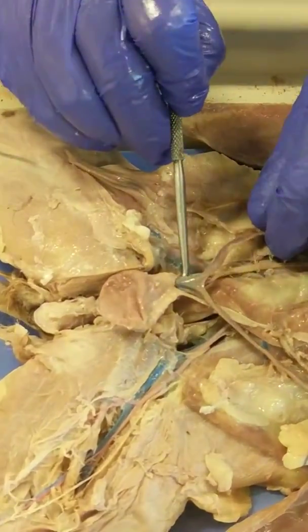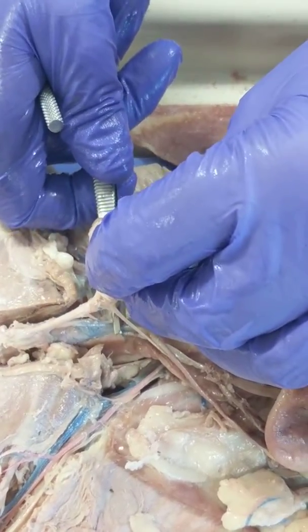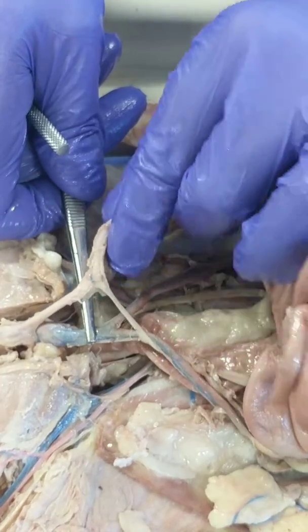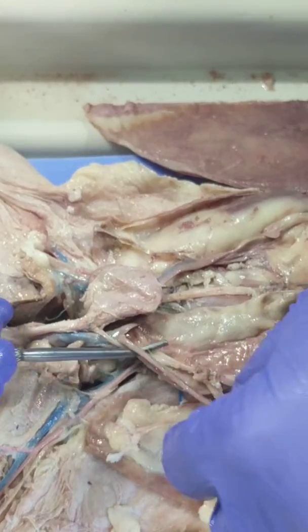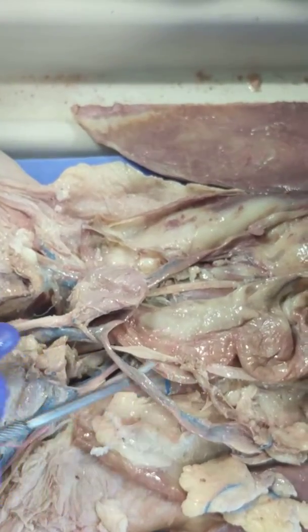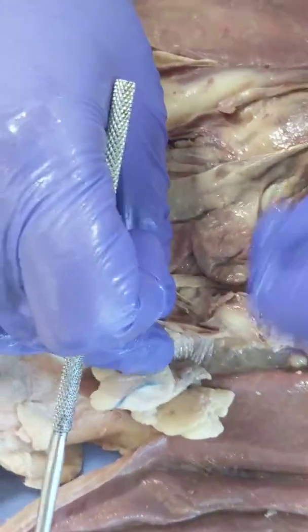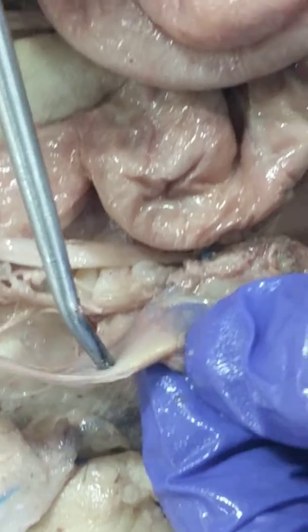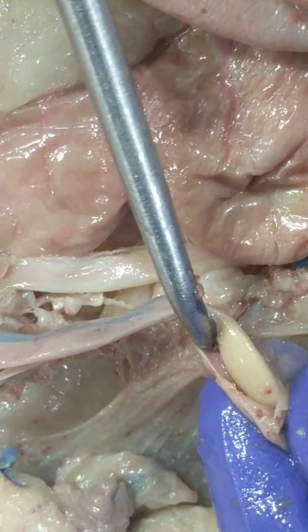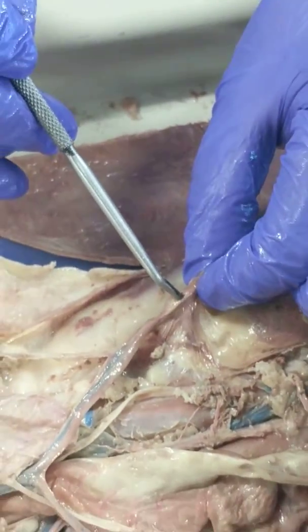At the base of the bladder is the uterus — this structure right here is the uterus. I don't know why it's injected blue, but there are a lot of blood vessels. This is the uterine horn, which has, on the left side, an ovary attached right here. Ovary, uterine horn — on this side we have another uterine horn, and the ovary is attached at the end.